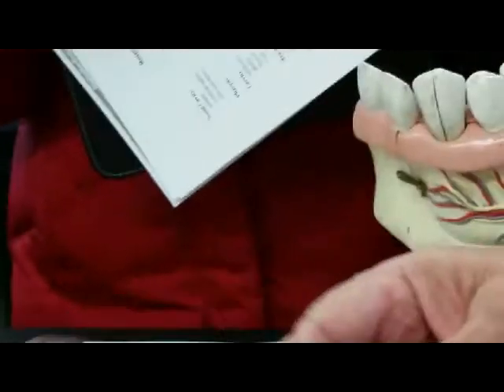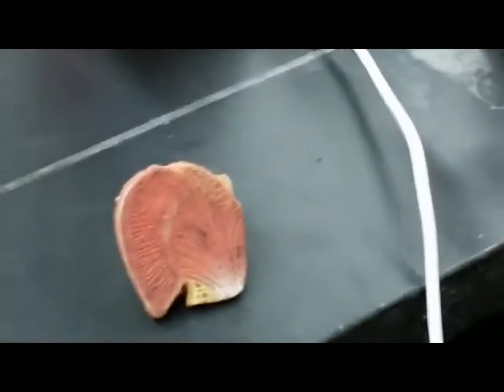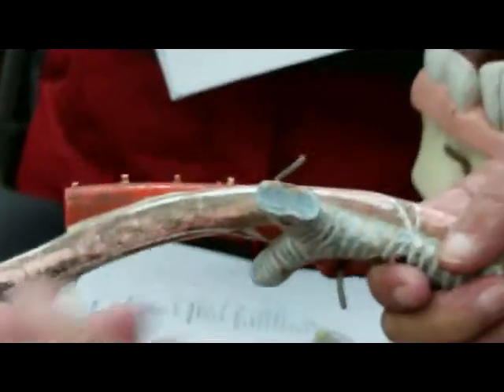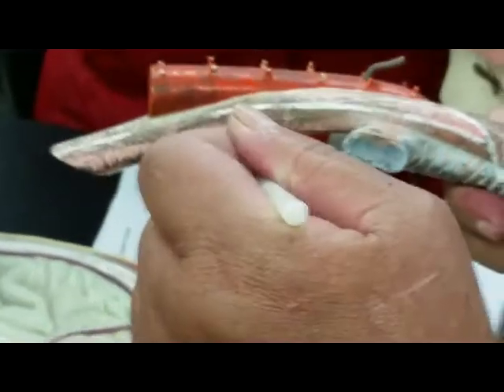So let's do the same thing you're seeing here, smaller portion. If you do like this, you're seeing the taste buds on the tongue. So if you see this on the test, it is the tongue. Now, let's do the esophagus. Trachea, and lying behind the trachea, this tube represents the esophagus. This would be the aorta.